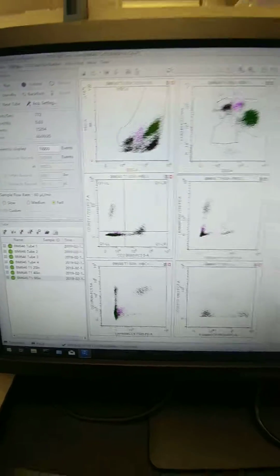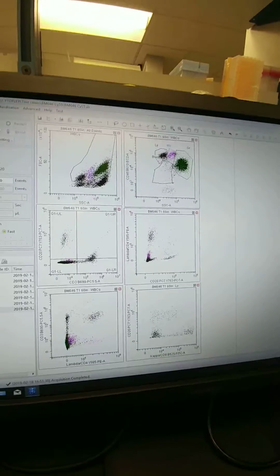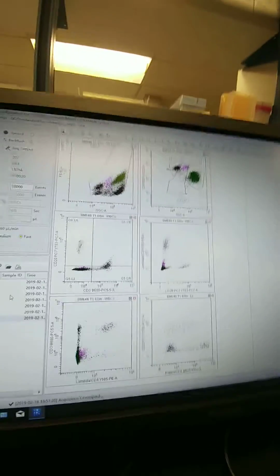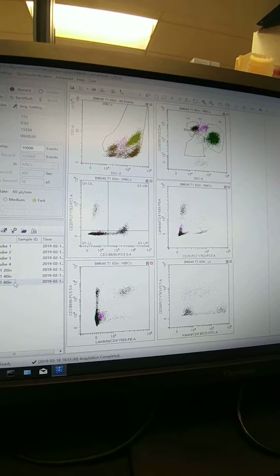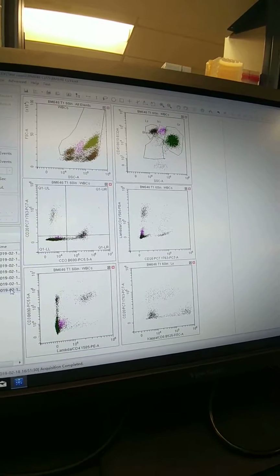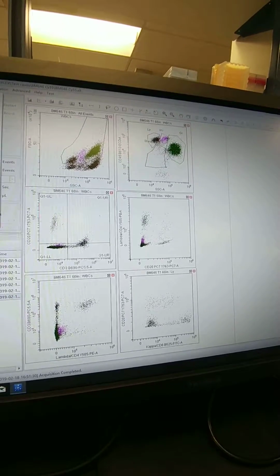Okay, so let's say we've analyzed it and Steve said he liked the one where we increased 60 from what we originally did. If you don't have that experiment open, you can just go to File, Open Experiment. I still have this one open now, so I'll just cheat and use it. If he said he liked the last one we did better, I'm going to click on that, and then I am going to have to remember how to do this.